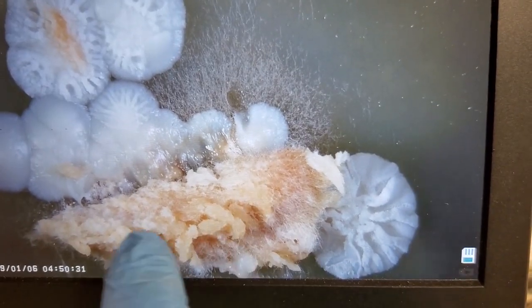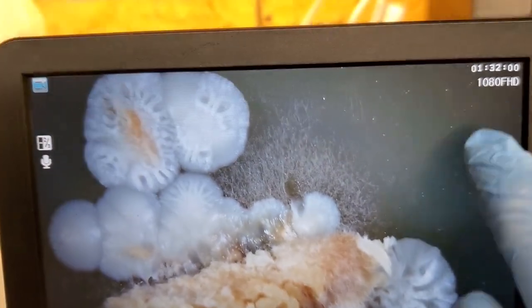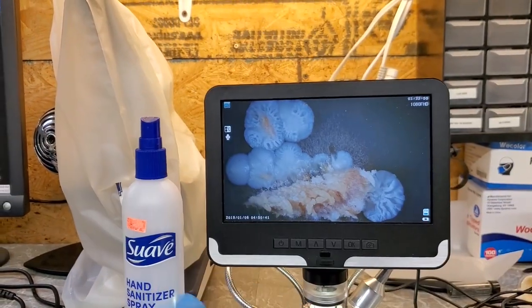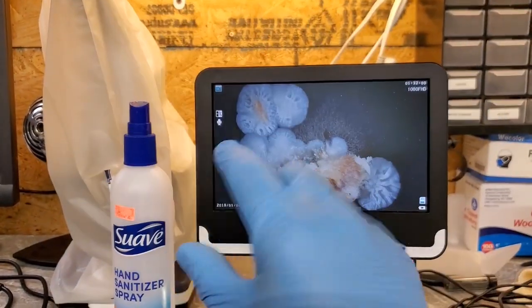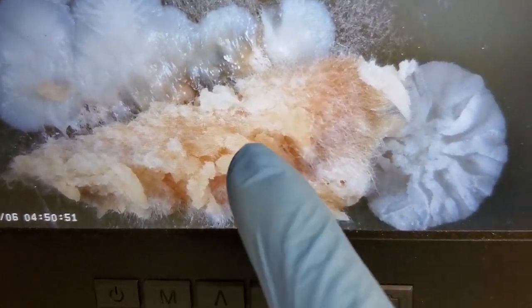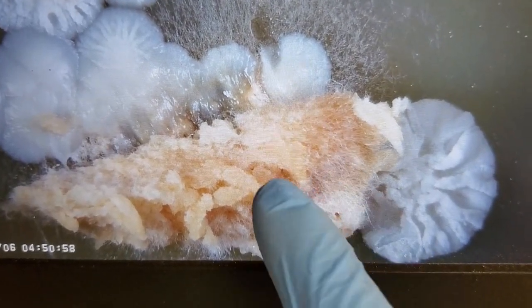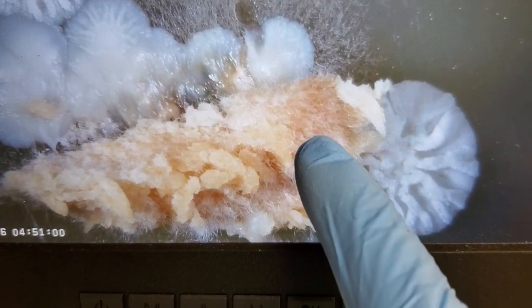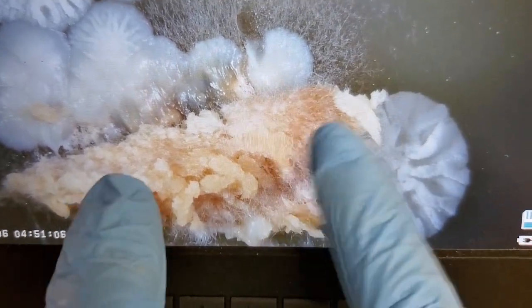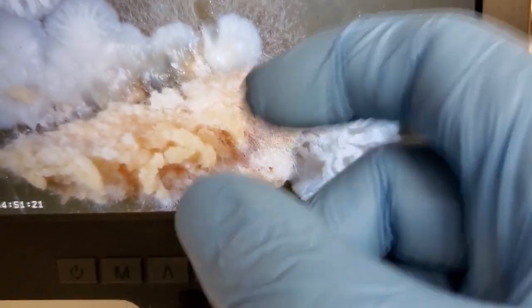Right here, this part is the part of the chicken of the woods tissue that we put on the petri dish. You have to imagine that all the stuff around here in a big circle is the petri dish, so this whole thing is agar, and this is laying pretty much in the middle of the agar. So chicken of the woods, and you can see it's starting to put off this, which is what mushroom mycelium looks like when it's growing from a cloned piece of fungal tissue. It starts putting out these little thin wisps of mycelium, because remember, the fruit body that we're eating is just a concentrated mass of the mycelium from the main colony.